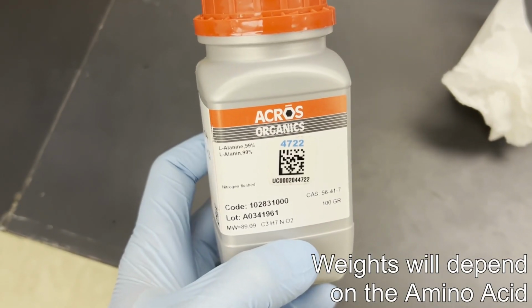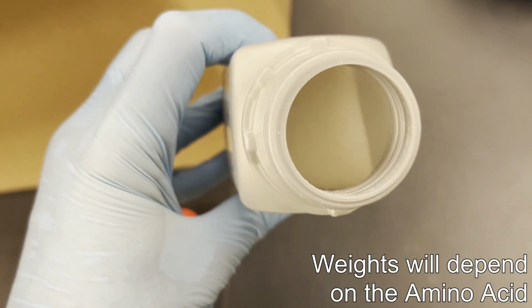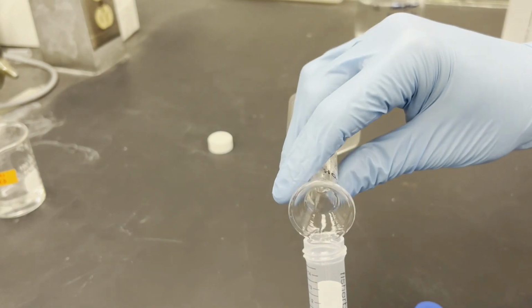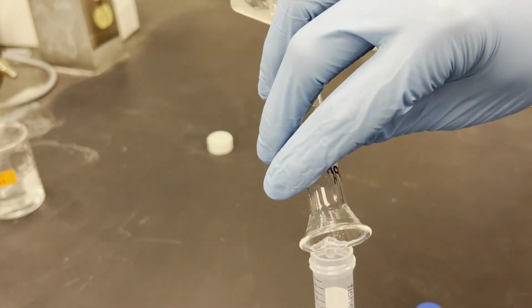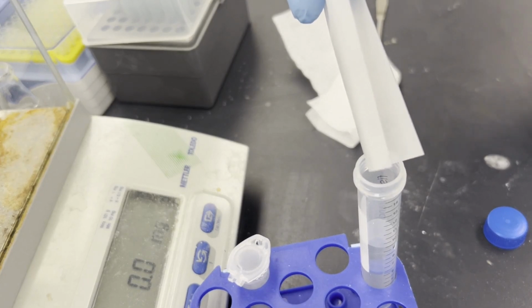We will need a set of standard amino acid solutions of our target analyte, enantiomers, and similar elution time amino acids to generate our standard curve for identification and quantification. To make our 50 millimolar stock solution, we'll begin by adding water to the plastic vial for the same reason we did the bicarb. Some amino acids will be more trouble to dissolve than even it was.